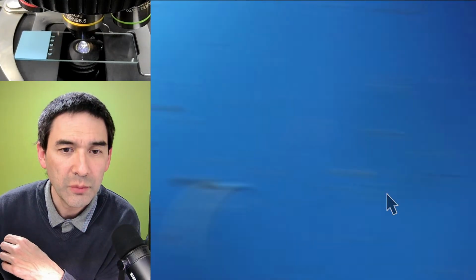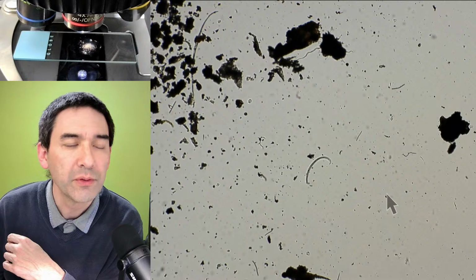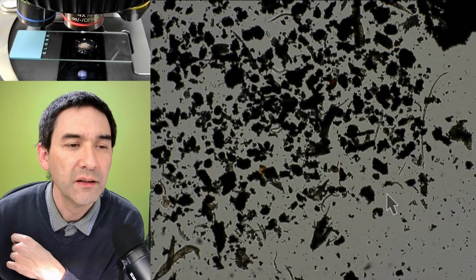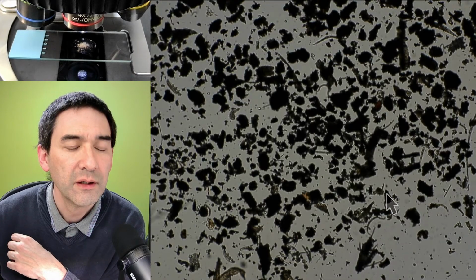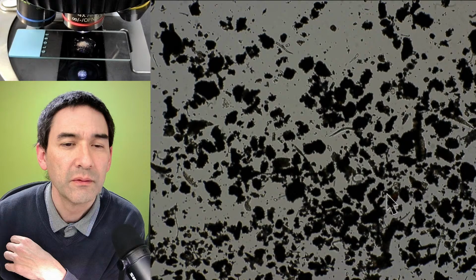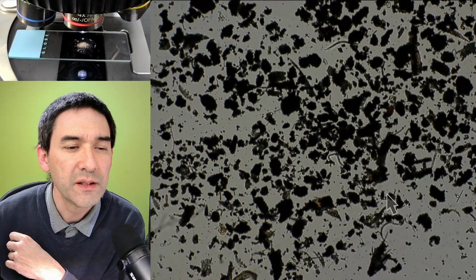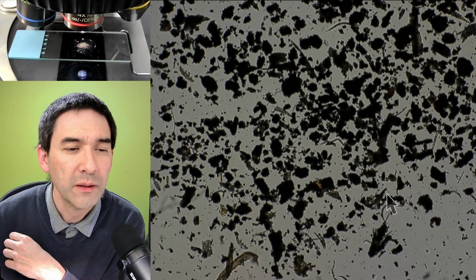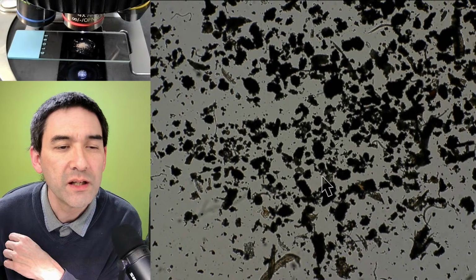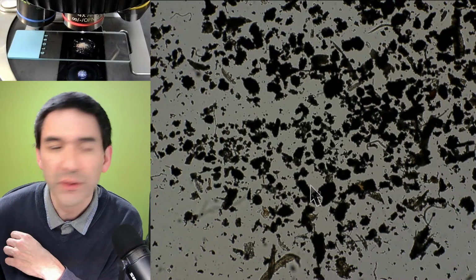And then here we go. Okay, and then we start again with a low magnification. Let's see what we're able to see here. So that's now my 4 times. Usually what I do is scan the whole slide, and if there are lots of rotifers, then we're able to have a closer look at what we can find. This is still, I think, a little bit small, but I'm interested in this guy over here. Do you see this arrow? I don't know this. Let's have a look at what this is. Okay, so I'm going to move this one into the center.